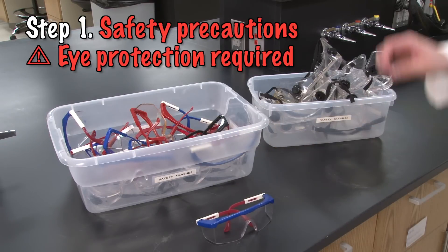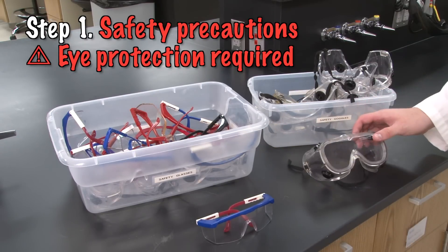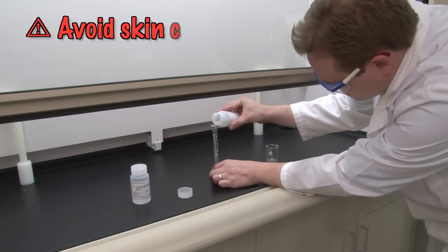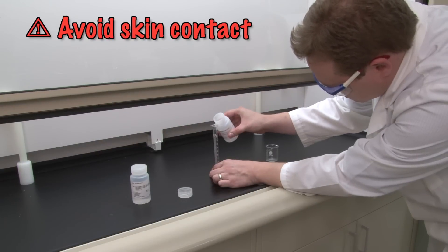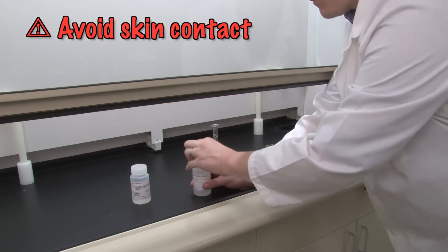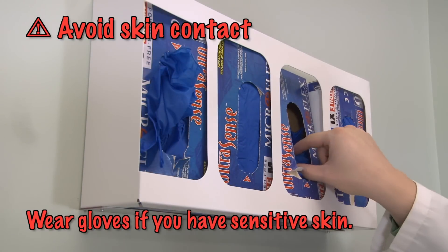You can follow along with the procedure printed in your lab manual. Safety glasses or goggles must be worn for the entire experiment. The solvents we will use may dry or irritate your skin, so be careful when you're pouring them. You may want to wear gloves if you have sensitive skin.